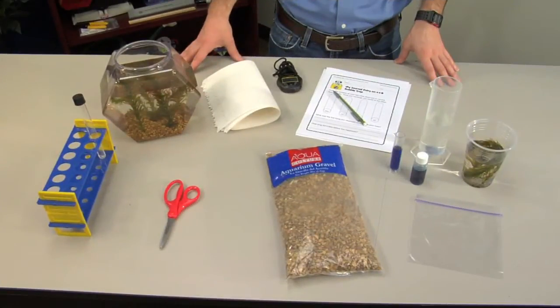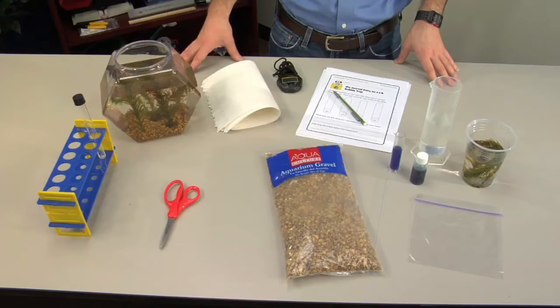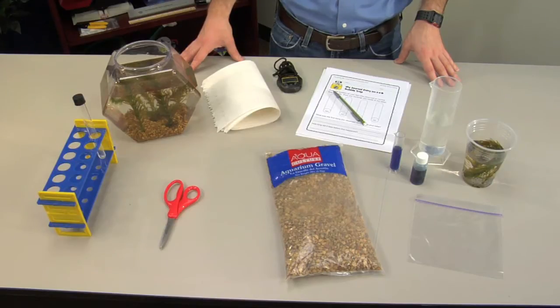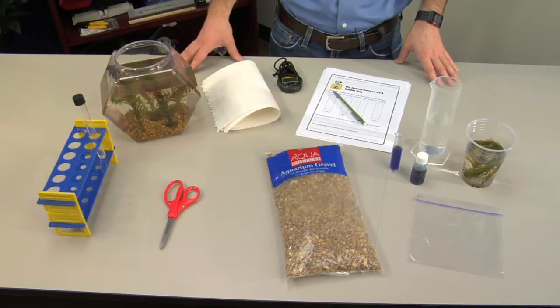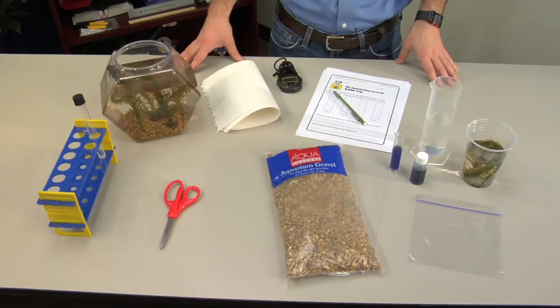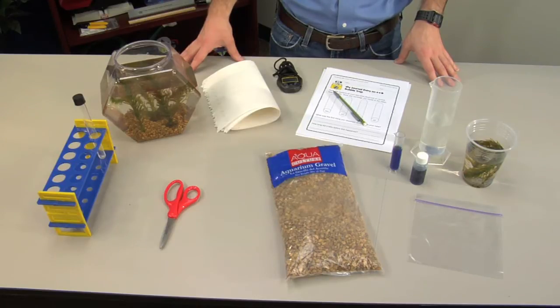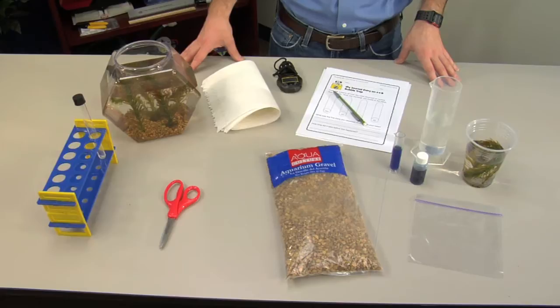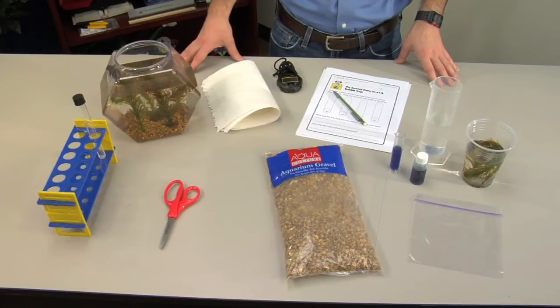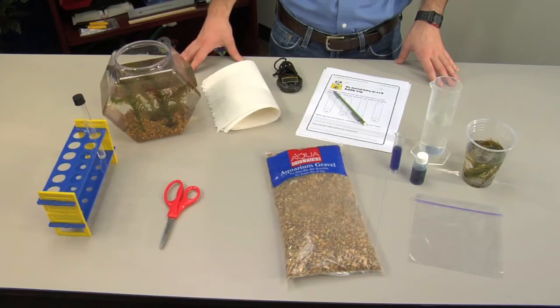Prepare the following items in advance for each group in your class: transparent test tubes with lids, Elodea aquarium plants, a clear container, gravel for the container bottom, water, scissors, small plastic baggies, bromothymol blue, and a small graduated cylinder.